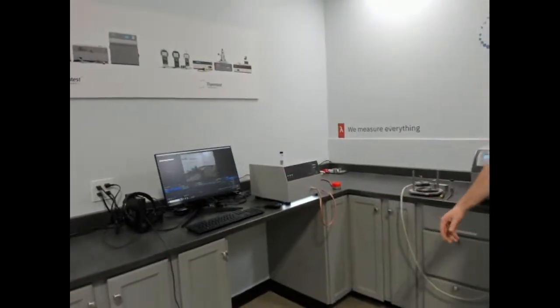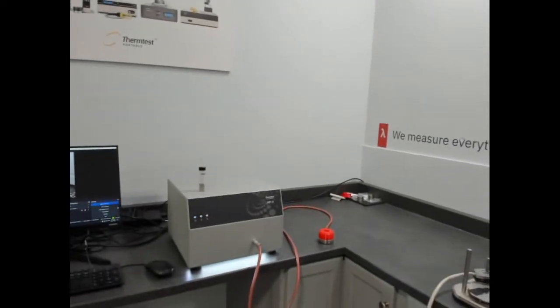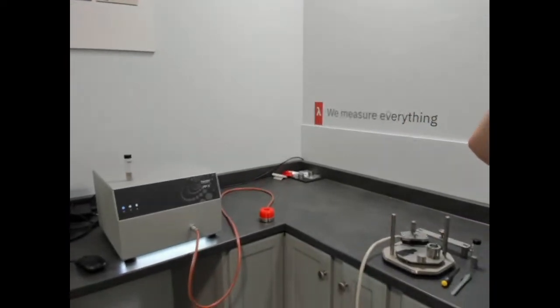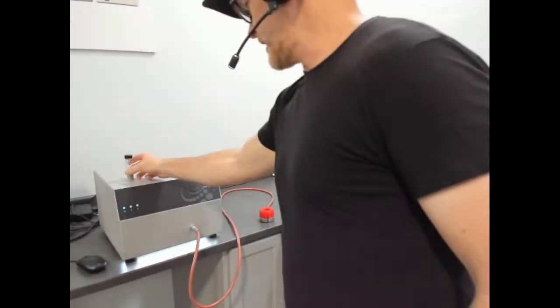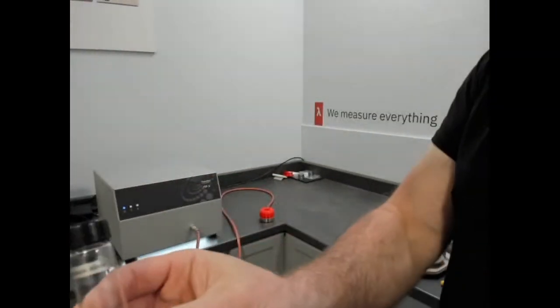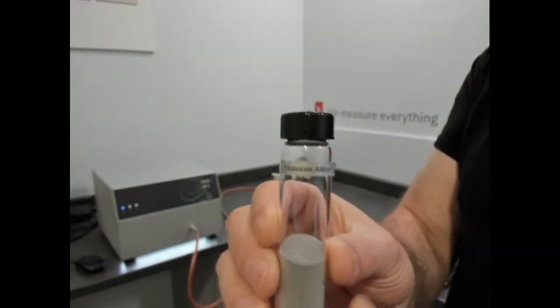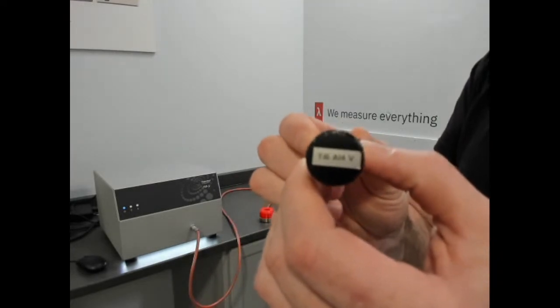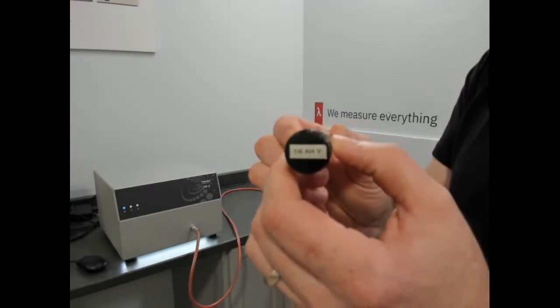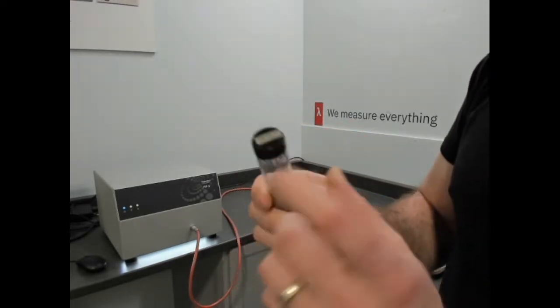So maybe what we can do is pull a little closer, square on with the MP-V, and we'll talk a little bit about it, and then we'll get into a demonstration of measurement today. We'll be doing a titanium powder. There you go, titanium alloy. This is typically used in 3D printing.